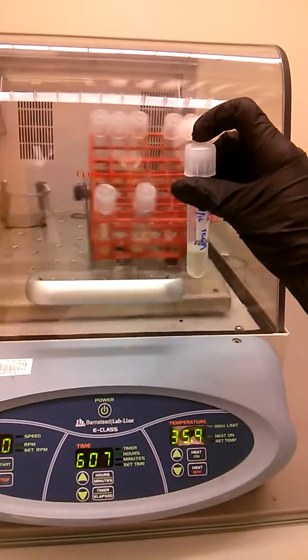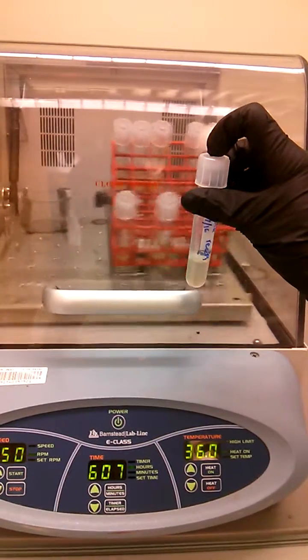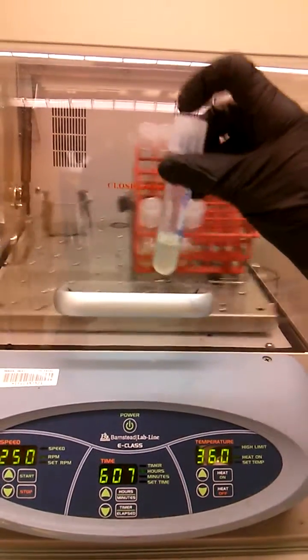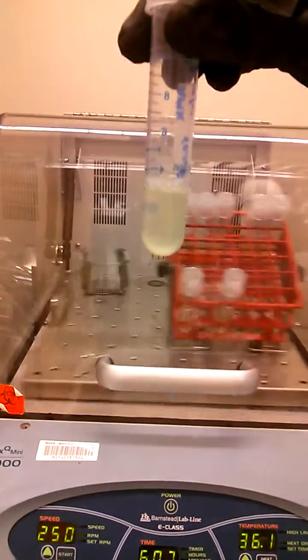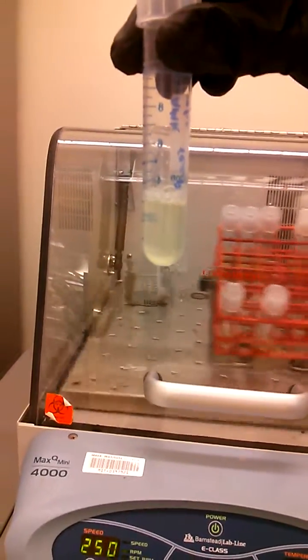This is the next segment of P1 transduction. After about four hours of letting the P1 phage infect, we can now see that our REC-A culture infected by the donor phage has cleared up.